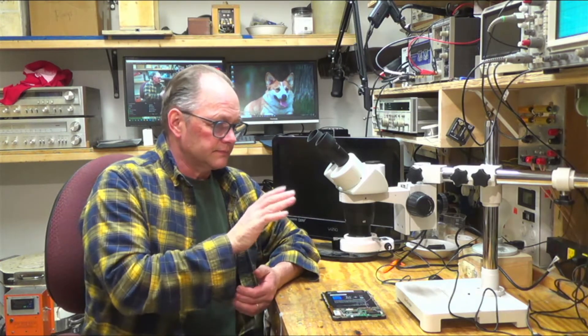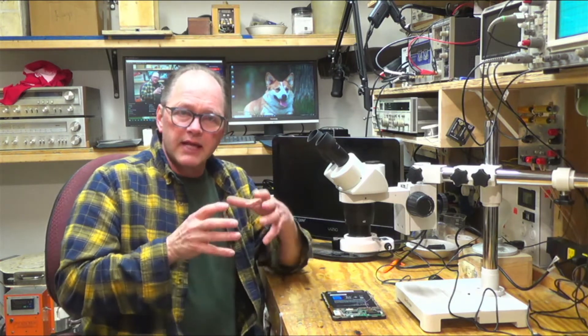But then on the back here it's got a port for a camera. So I thought, well, I want to buy a camera for it. And I went on Amscope—this is an Amscope brand microscope.